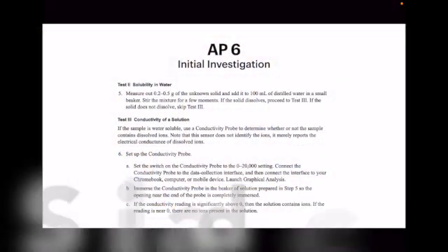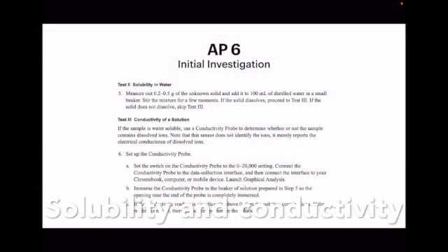Great job. Next is solubility in water. We're going to add a little bit of water to the substance, and we're going to see if we can get it to dissolve. You could also use universal indicator at that point to see, is it an acid or a base? Or is it neutral? That's also additional information you get.